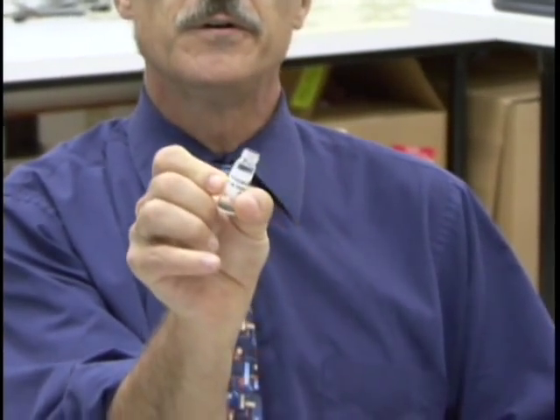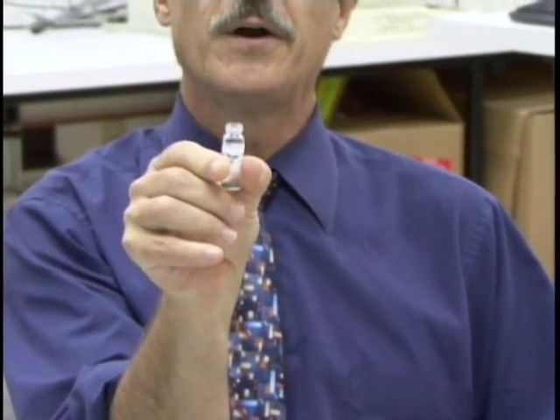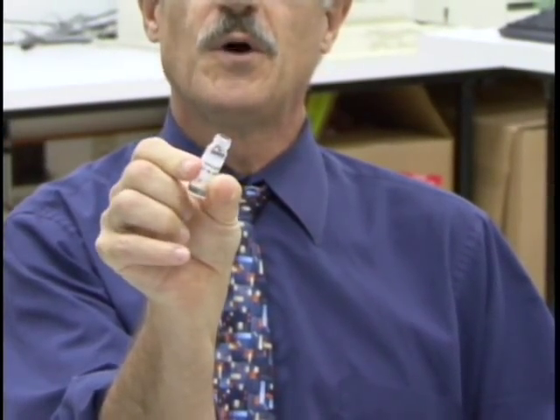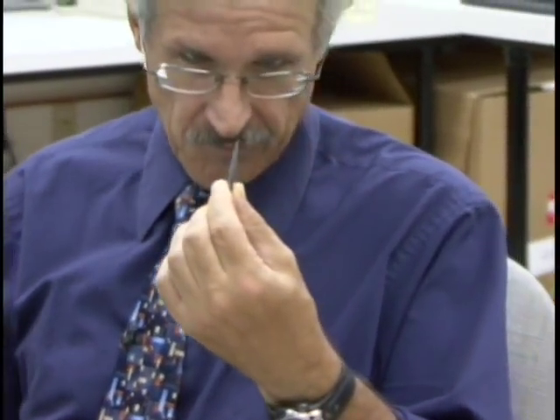We're going to go ahead and measure a gunpowder particle. This is a Winchester SuperTarget AA smokeless ball powder. I've tried to grab a particle of this with some forceps and we're going to go ahead and stick it in front of the dart.